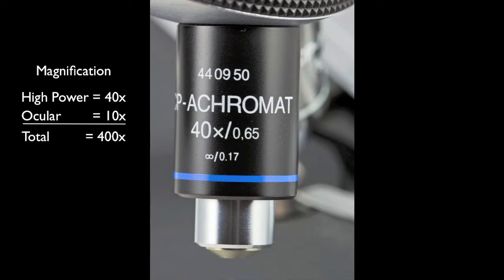So, when turning the high power objective into place, rest assured that the lens will not strike the slide if you have focused correctly with the low power objective.